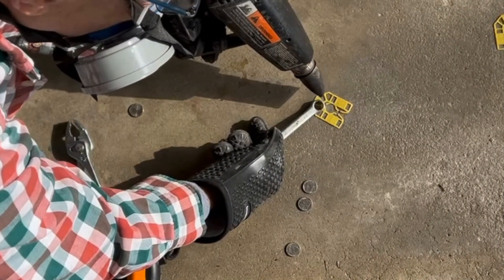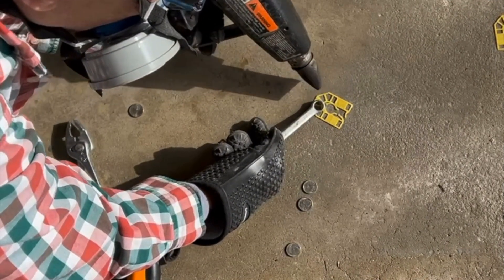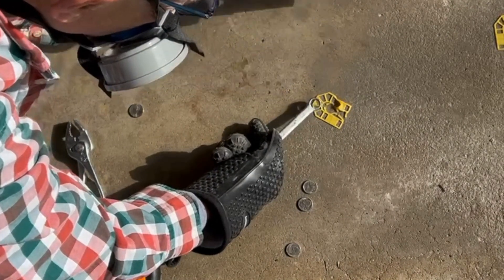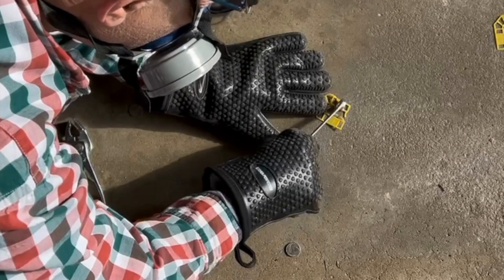This fourth object melts clearly upon heating, doesn't undergo a color change, and reforms into a new shape. So I'm assuming this one is a thermoplastic.